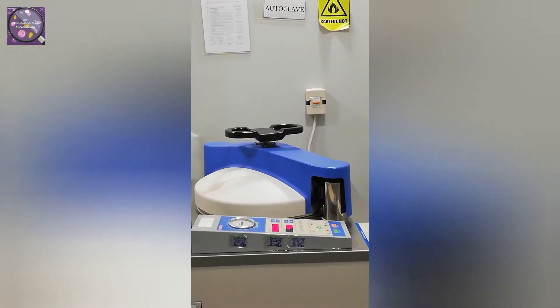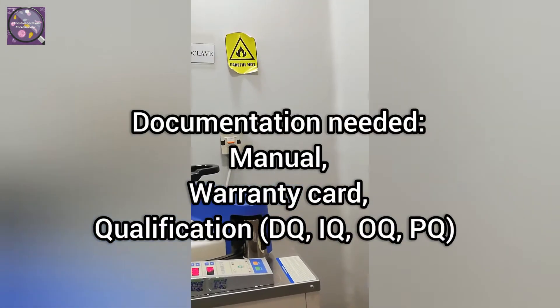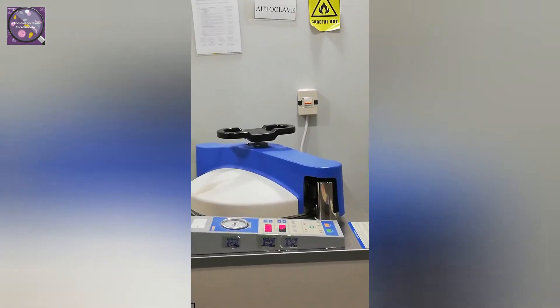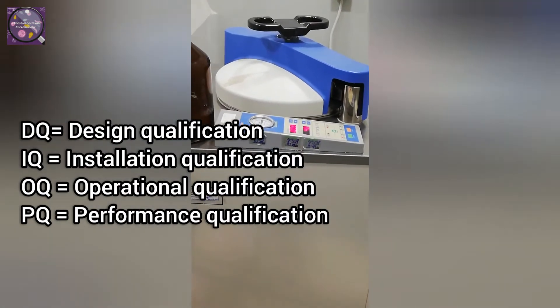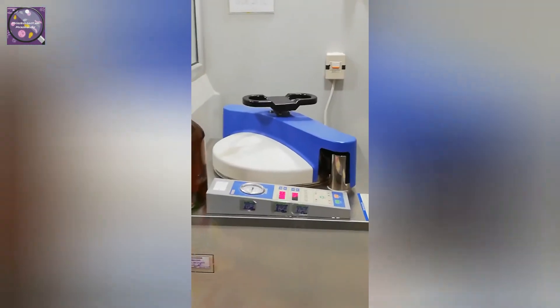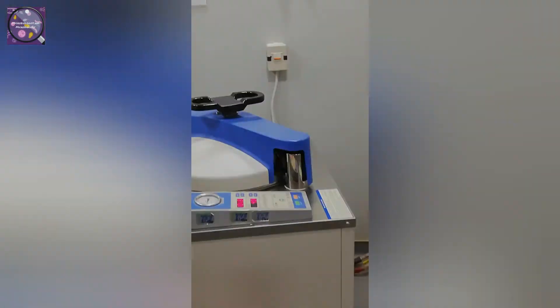Make sure to get the manual of your autoclave from the supplier and also do the validation by the supplier — especially Design Qualification (DQ) and Installation Qualification (IQ). PQ and OQ are most probably done by the user, but you can ask the supplier, because some suppliers will provide IQ, OQ, and PQ collectively. You must take the manual and the documentation of IQ, OQ, and PQ from the supplier.